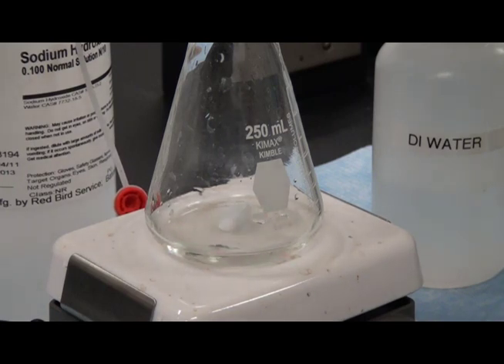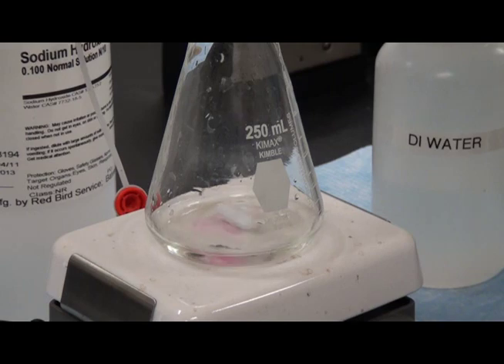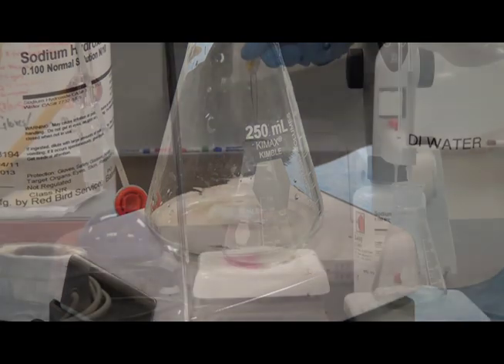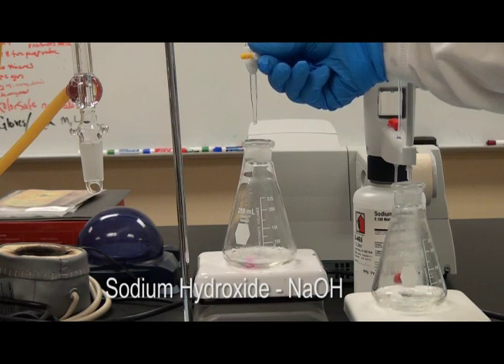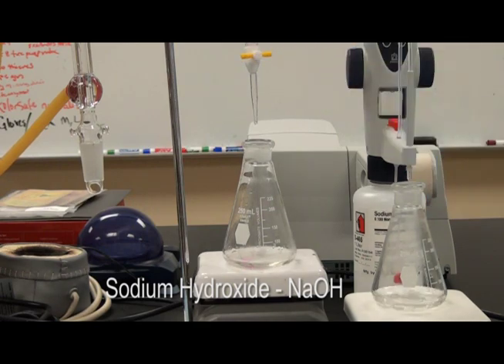The titratable acidity, or TA, of wine or must is determined by titration of a sample with a standardized solution of sodium hydroxide, NaOH.